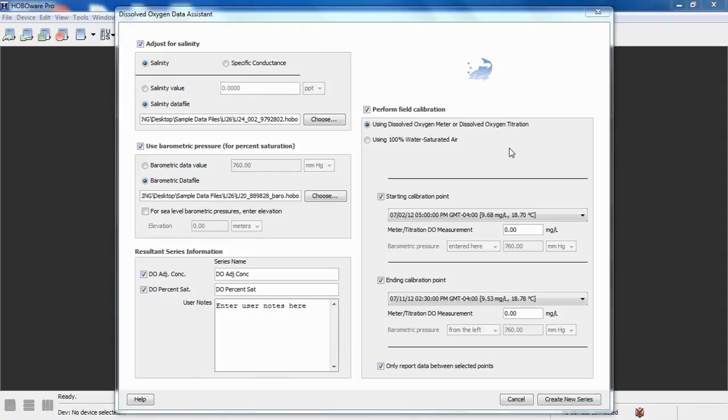Typically, in most of your deployments you will get some fouling. So this is where field calibration becomes very useful, because you can compensate your data for that, or correct your data, I should say, based on some field calibration method. What we give you, as you see, is a starting calibration point and an ending calibration point. If you're using the DO meter or dissolved oxygen titration method, we give you the ability to enter or reference a calibrated value of DO in milligrams per liter that represents a specific data point at the beginning of your deployment and near the end of your deployment.